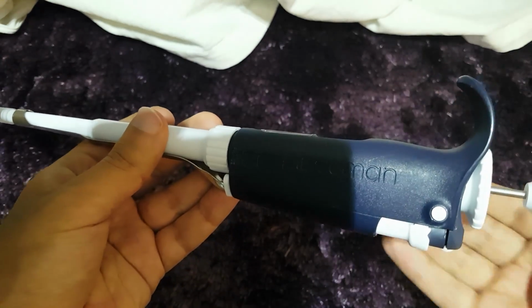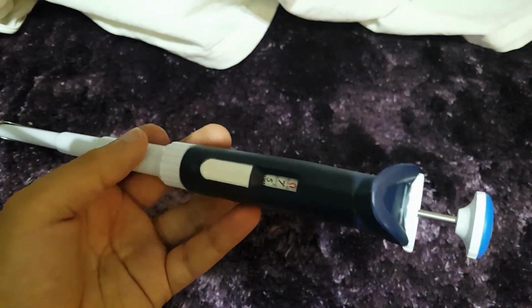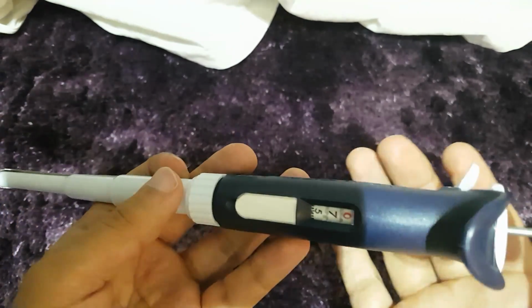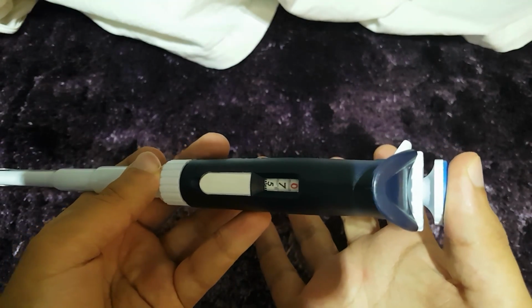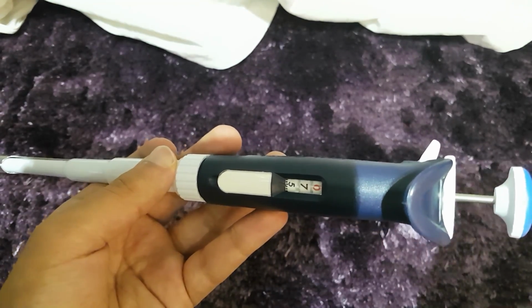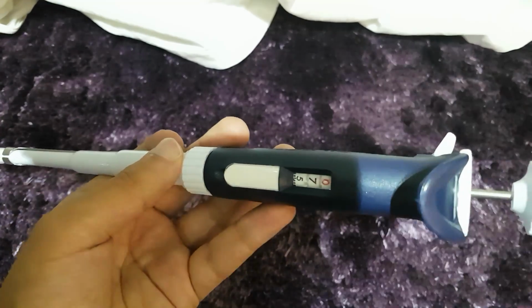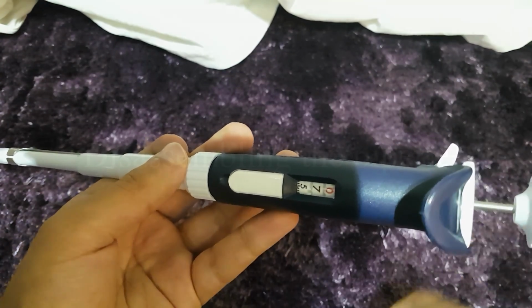So, how does this pipette work? This pipette works by displacing air. As you can imagine, when you push down, you're displacing air. When you go back up again on the plunger, it's taking air in, and that is how the pipette sucks up fluid and then pushes it back out.